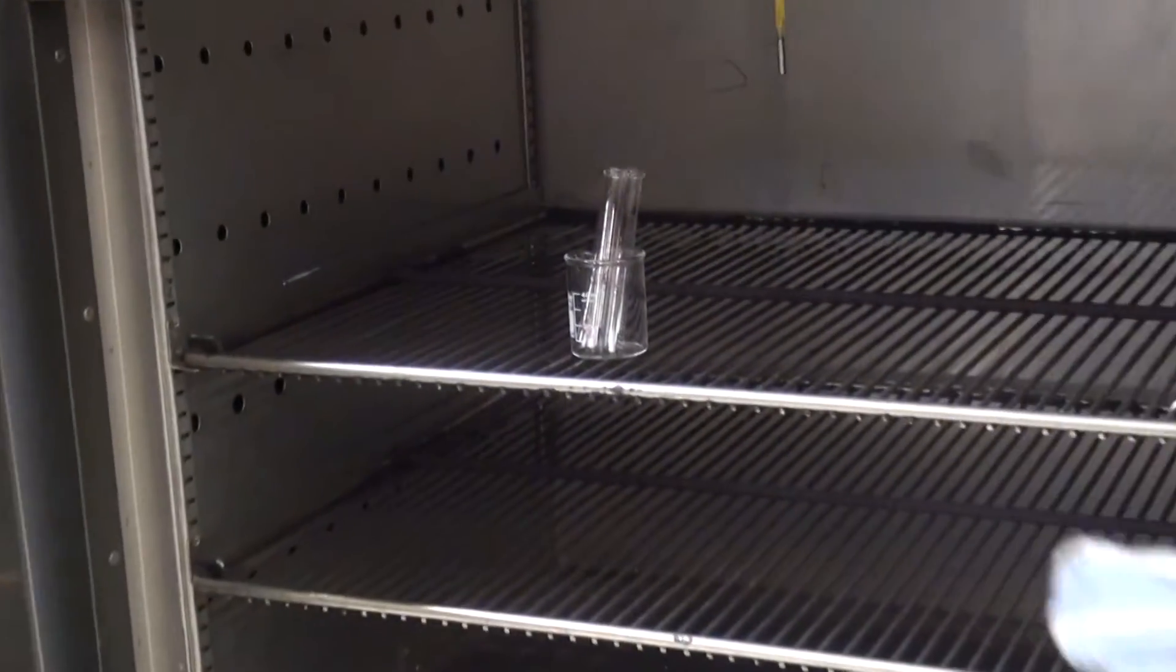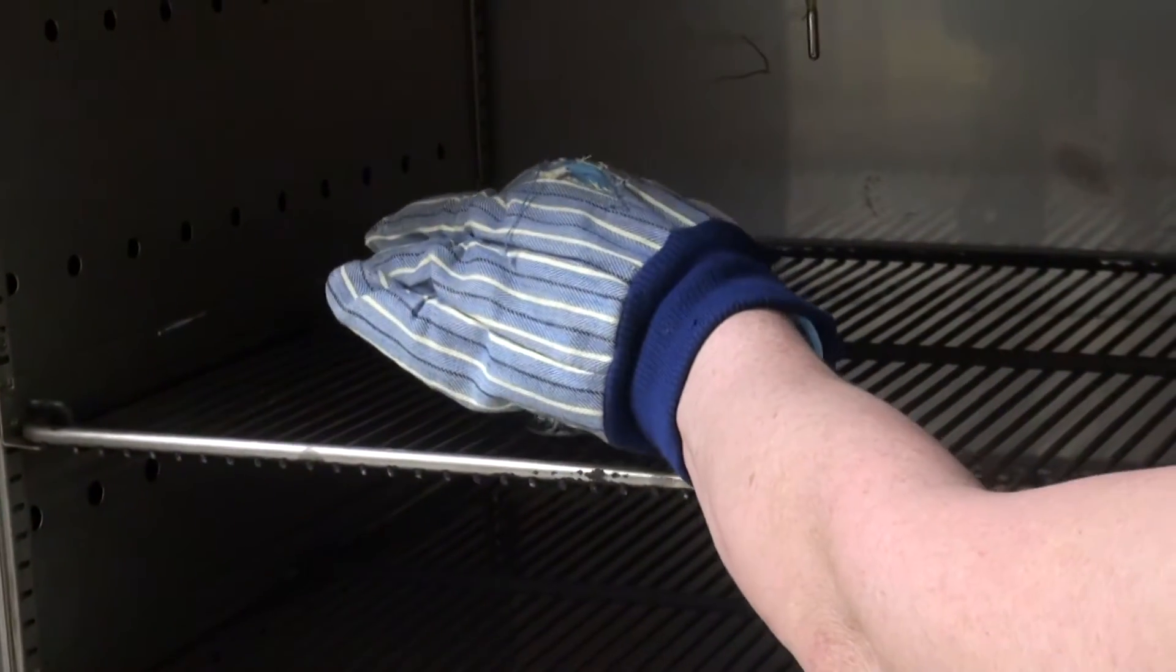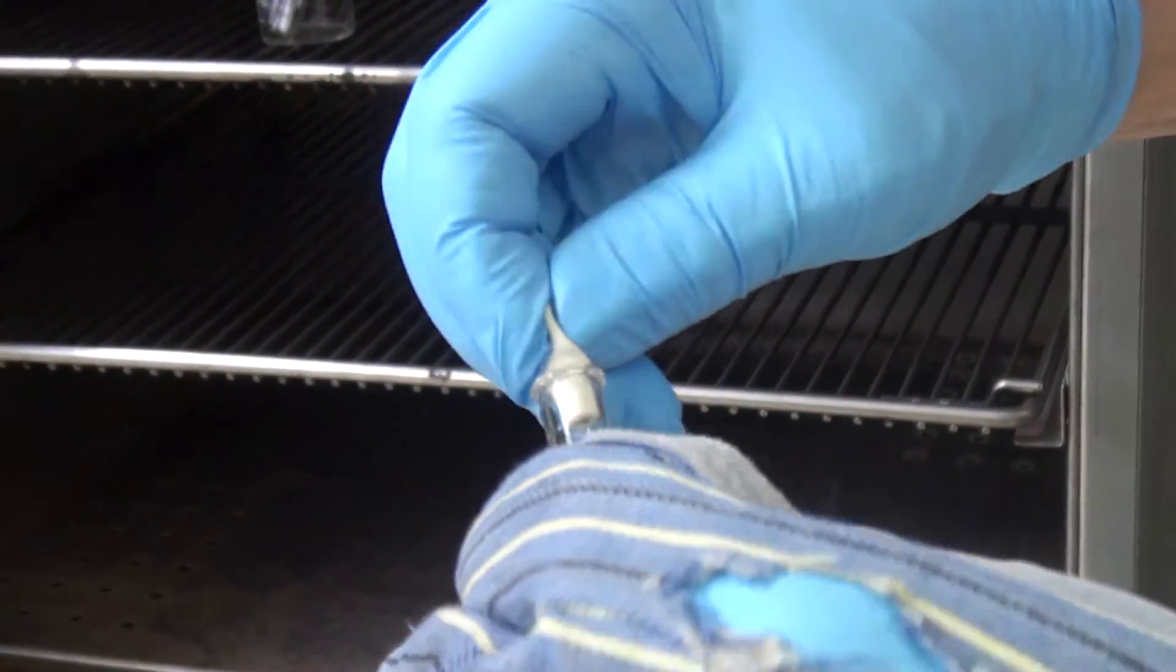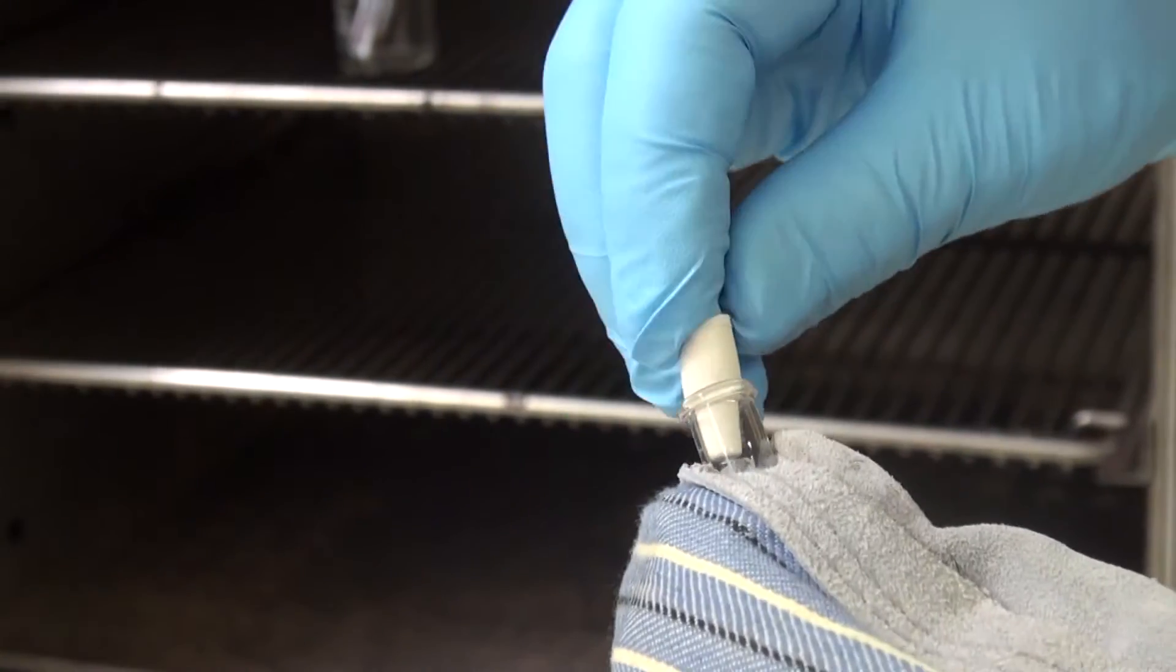It should be dry. Wear gloves, otherwise you'll burn yourself. Take the reaction tube out and immediately close it with a septum. Screw the septum in there.